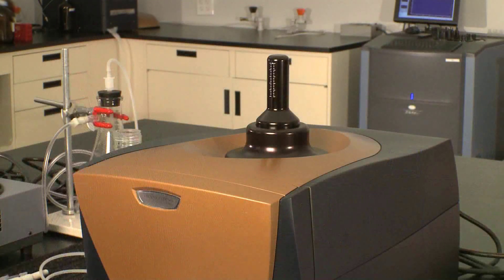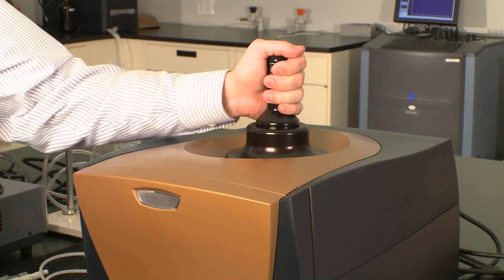In this TA Tech Tip, we'll be cleaning the Nano ITC. Now that your experiment is finished, we need to clean the ITC.